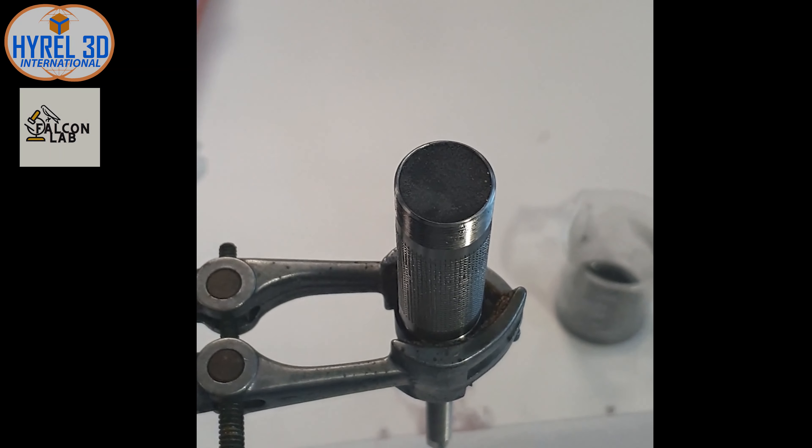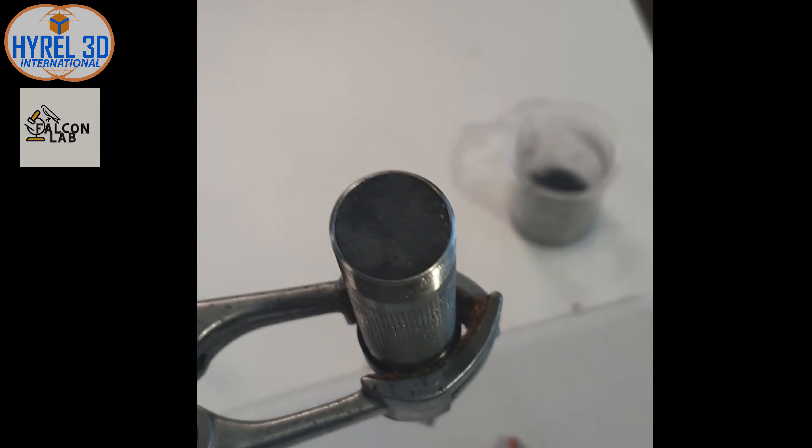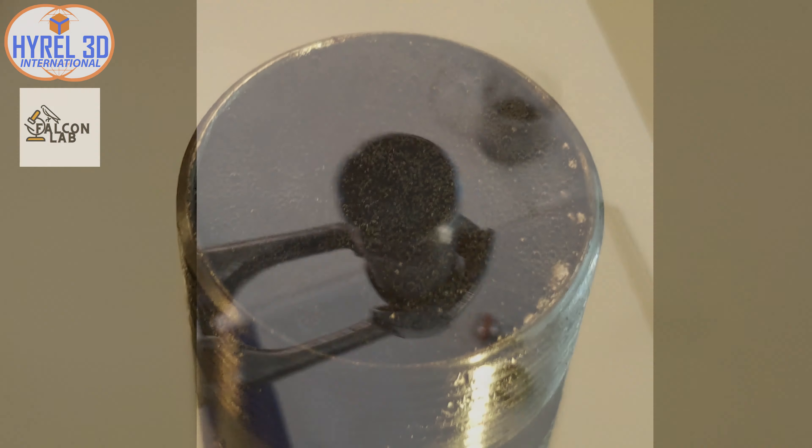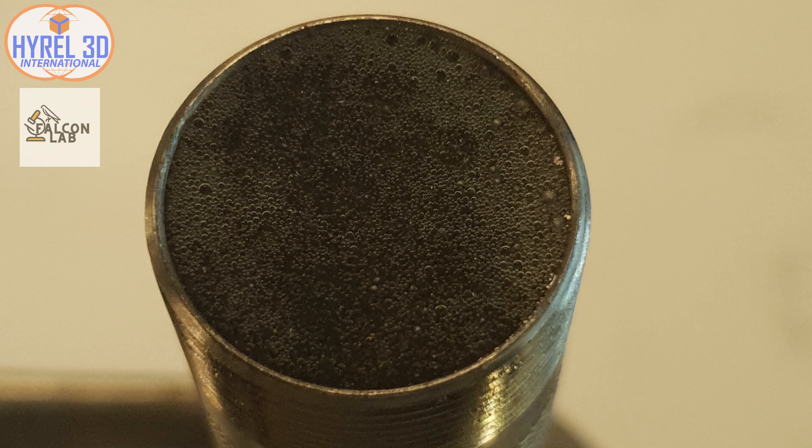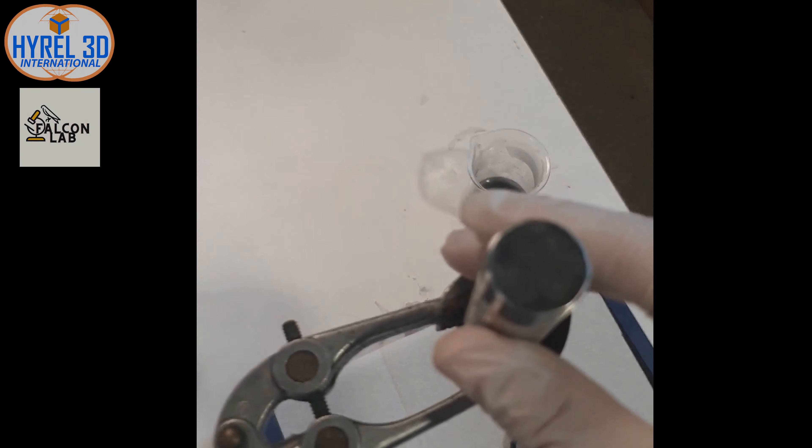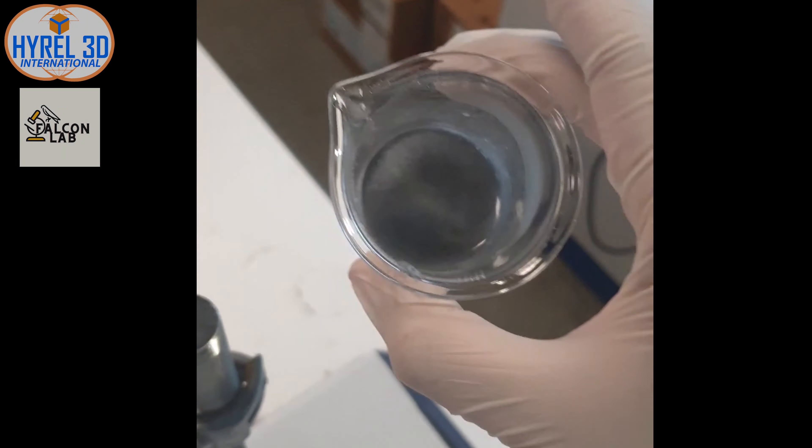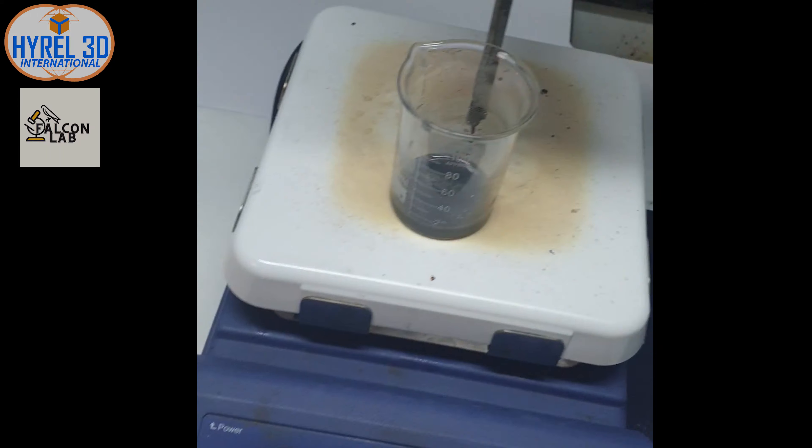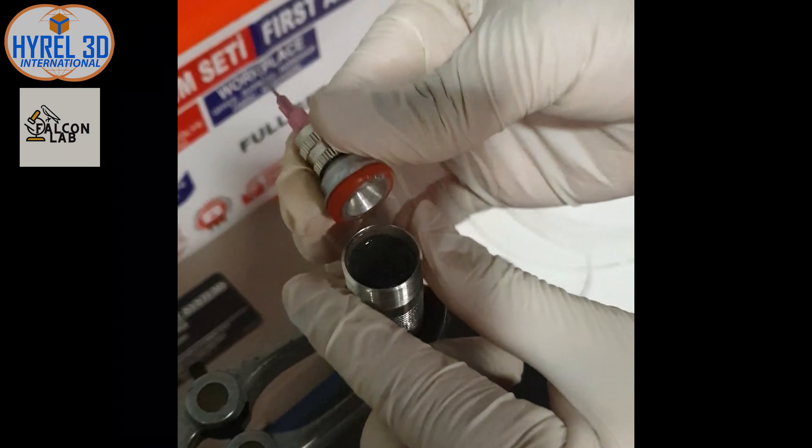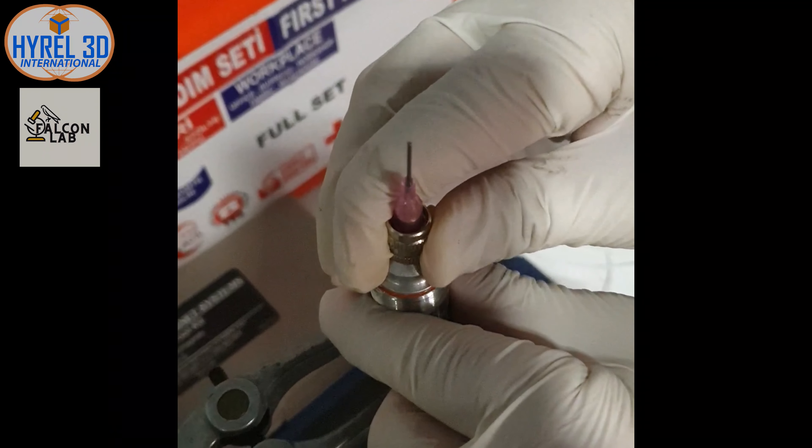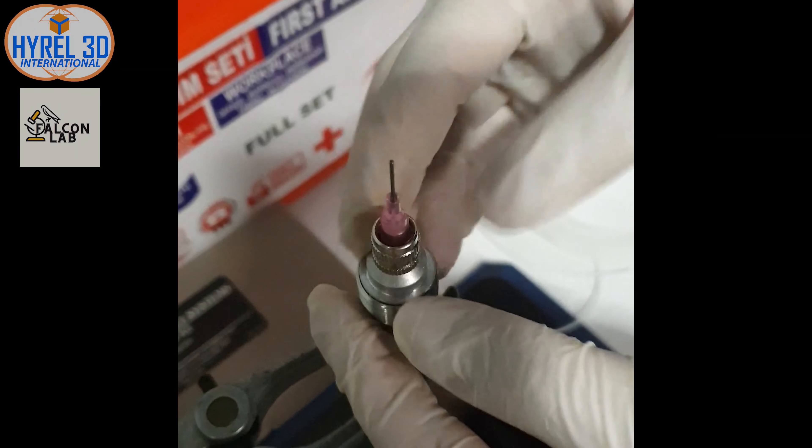Allow the hydrogel to rest for at least 30 minutes to allow air bubbles to rise freely to the surface. Always remember not to suppress air bubbles. You can use hydrogel again as it's preferable to store it at a low temperature to preserve it. I personally prefer to use 10 milliliters of hydrogel per print as you can control it easier and reduce waste as much as possible.